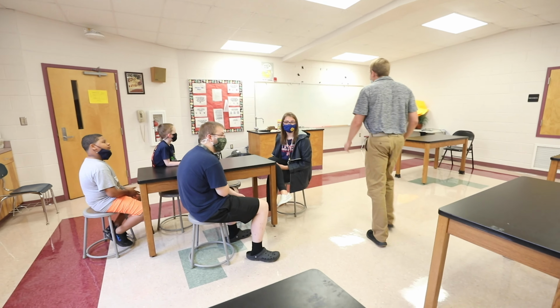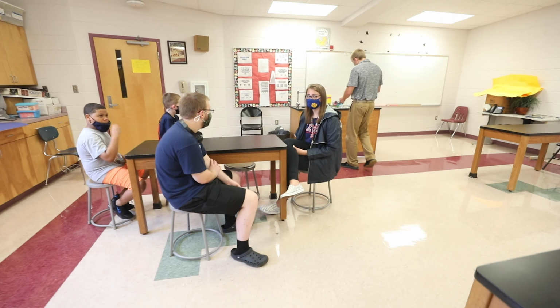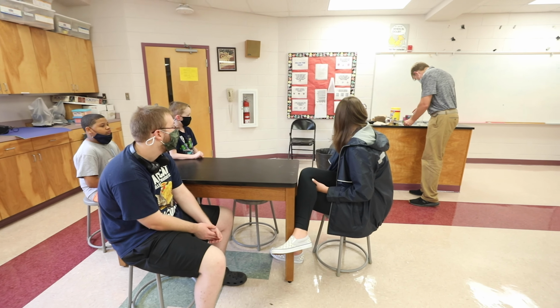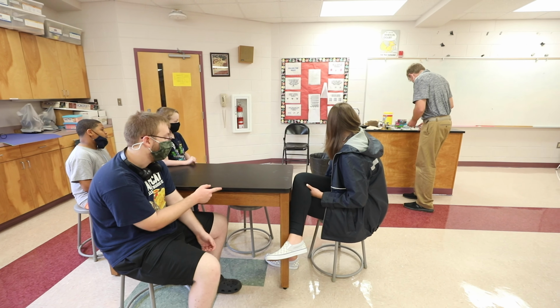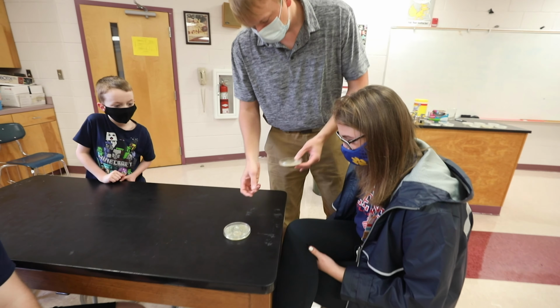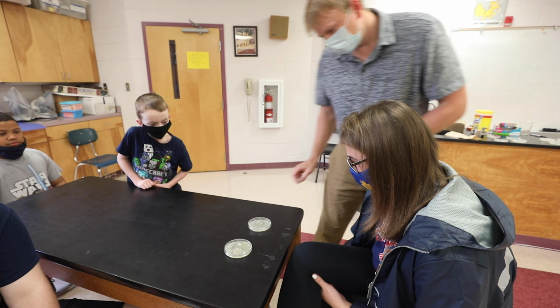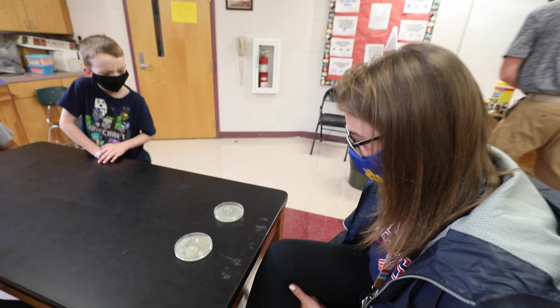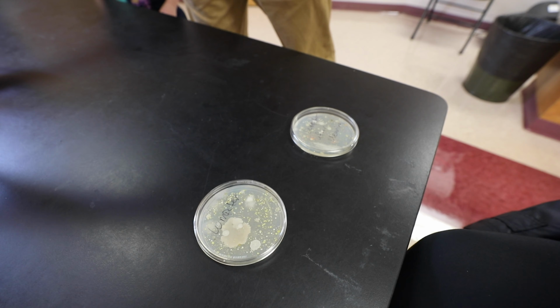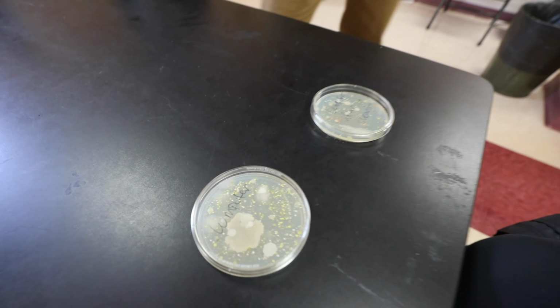All right, I'm going to set these in front of you. We're going to look at both of them. Don't touch them. We're just going to look at them. Who had the computer? I had the glass. Oh, that is weird. Right, how's it look, Megan? Ew. I would never use that again. Never use that computer again. I ain't touching it. You had stuff on, right? Just throw it away.